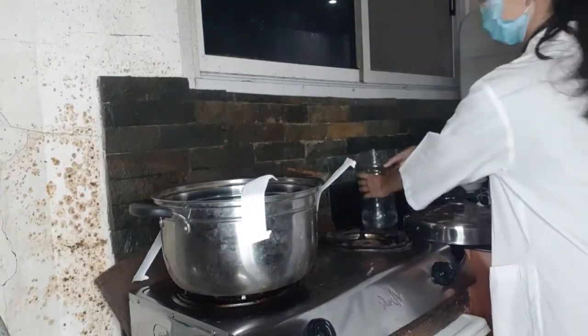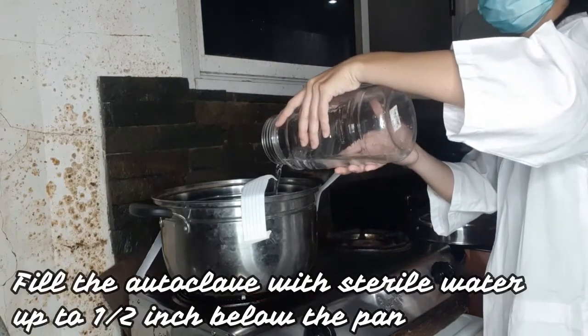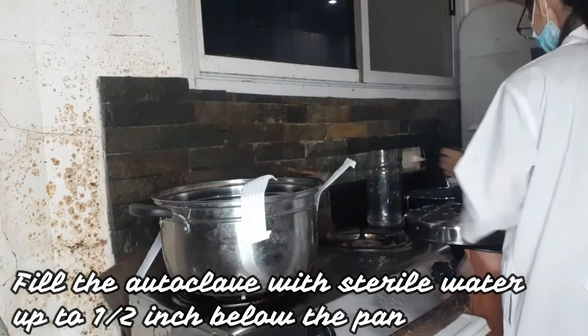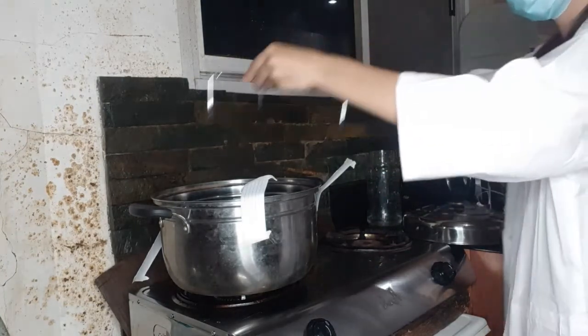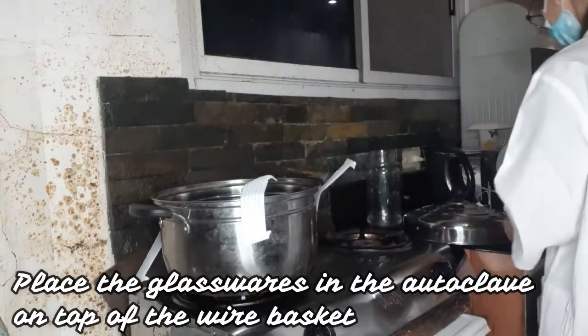Let's assume that the pot is an autoclave. Fill the autoclave with sterile water up to 1/2 inch below the pan. Next is place the glassware in the autoclave on top of the wire basket.